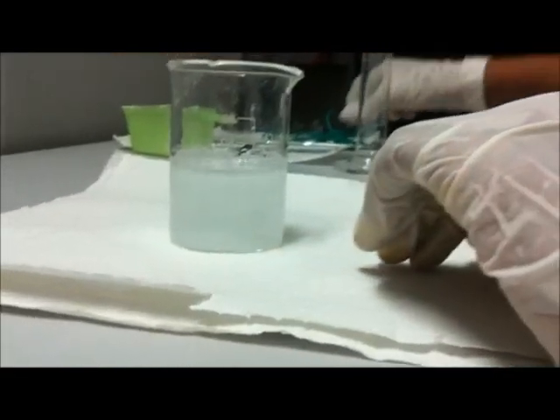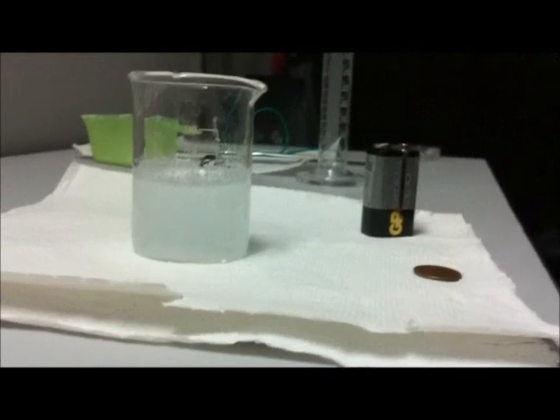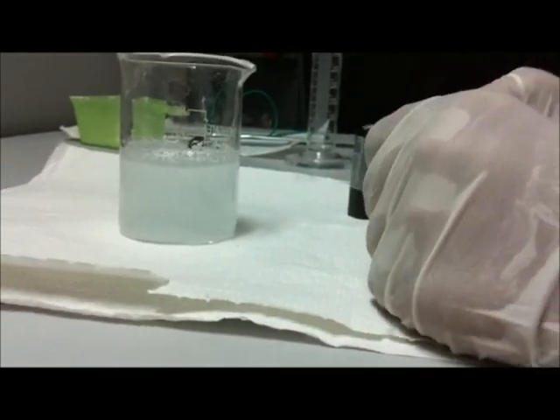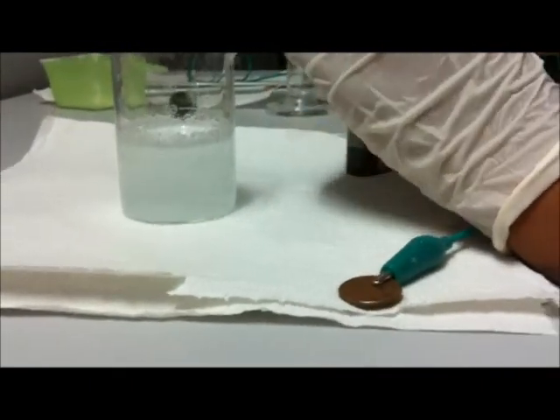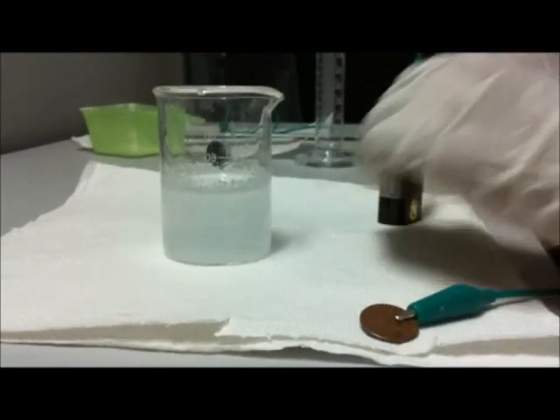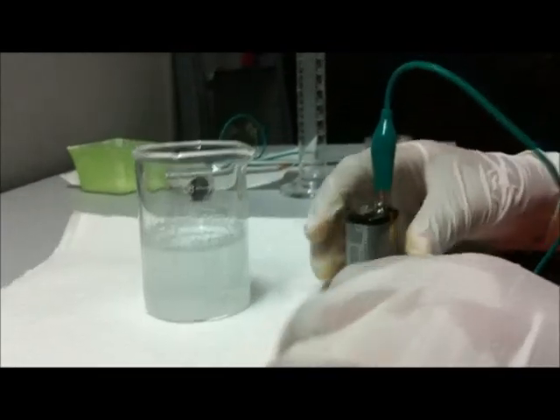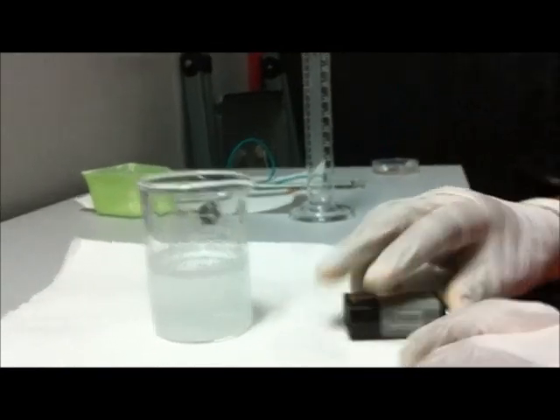Now let's start our electrodes, making our electrodes ready. We take the battery and the coin and get a wire. We connect the wire to the coin and connect it to the positive terminal of the battery. That's the coin connected.